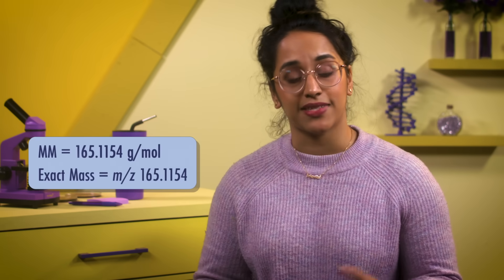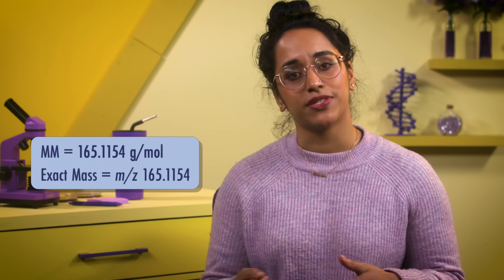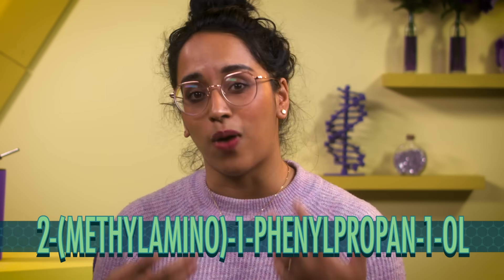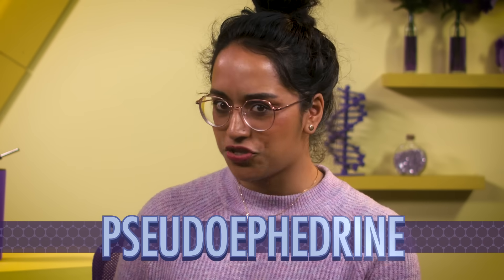We can use the exact mass along with molecular mass databases to identify the molecular formula. After doing this high-res mass spec on our substance, we learned that the molecular mass is 165.1154 grams per mole, and the published tables of exact mass and molecular formula lead us to C10H15NO. The top match for this fragmentation pattern and formula in the mass spec library is 2-methylamino-1-phenylpropan-1-ol. And the program gave us the common name too: pseudoephedrine. So we're getting closer!